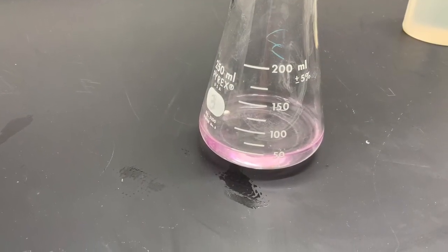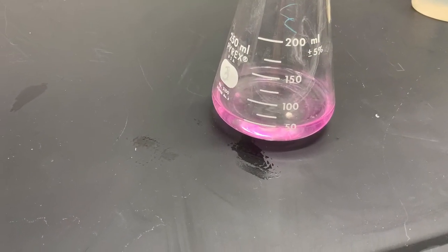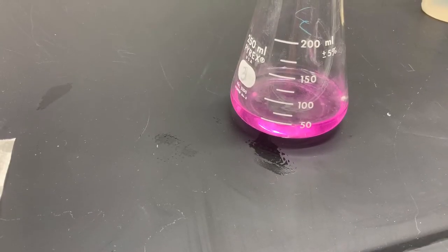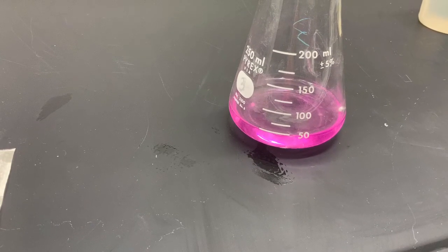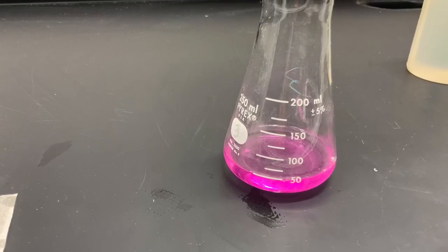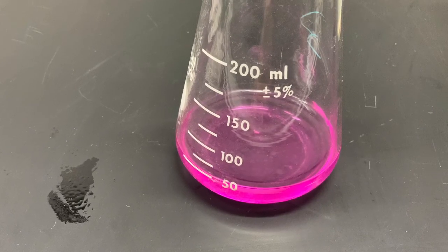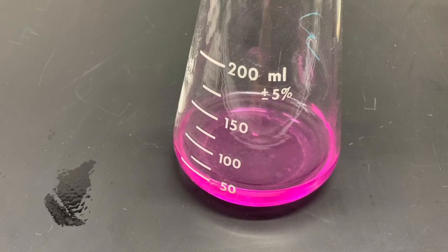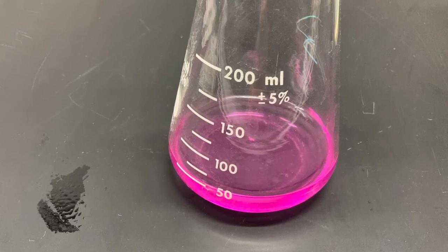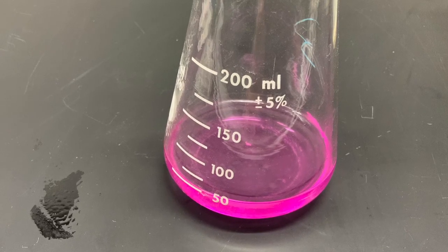Well, you can make out that little piece there as it dances on the surface of the water because sodium is less dense than water, so it will not sink in water. And you can see how it becomes increasingly more pink, so it reacts with the water and produces something that makes the water alkaline or basic. The alkali metal sodium has reacted with water and formed sodium hydroxide, which makes water alkaline.